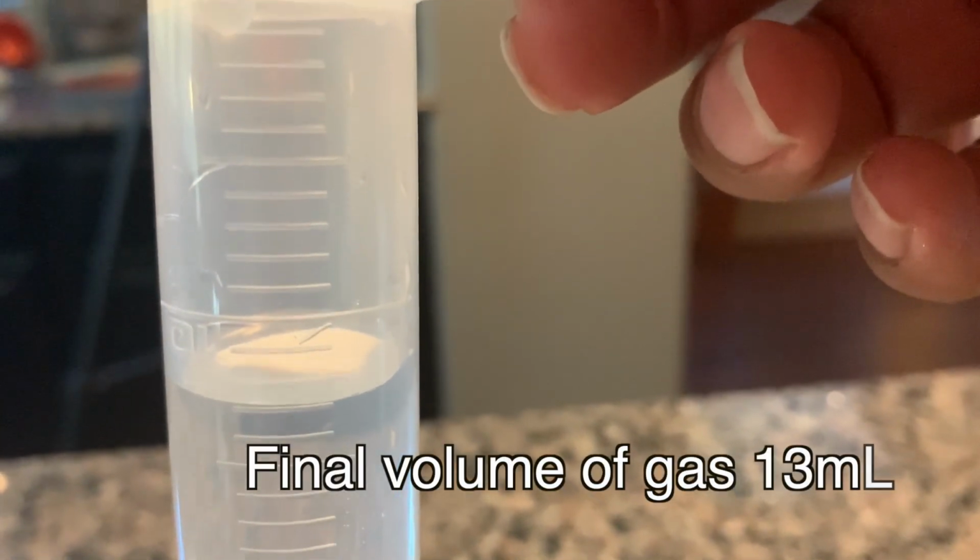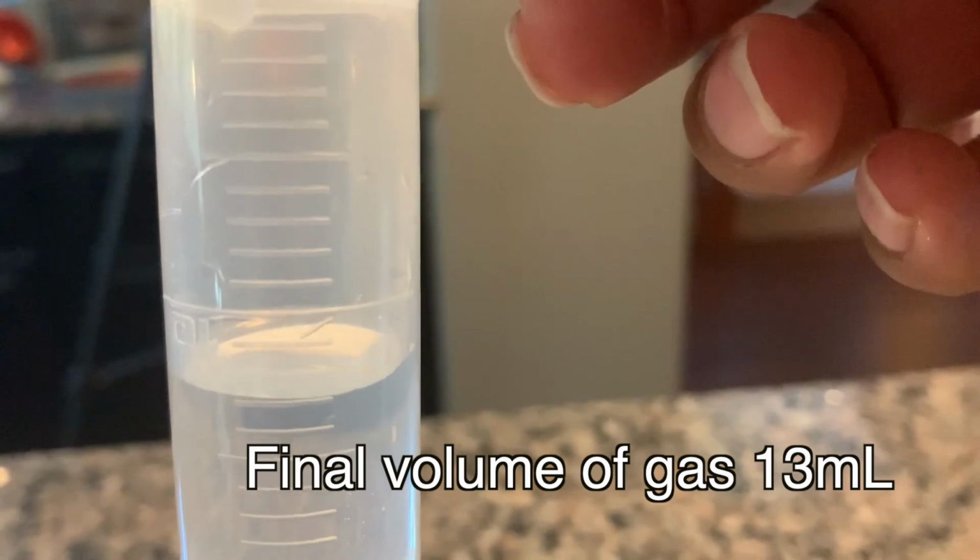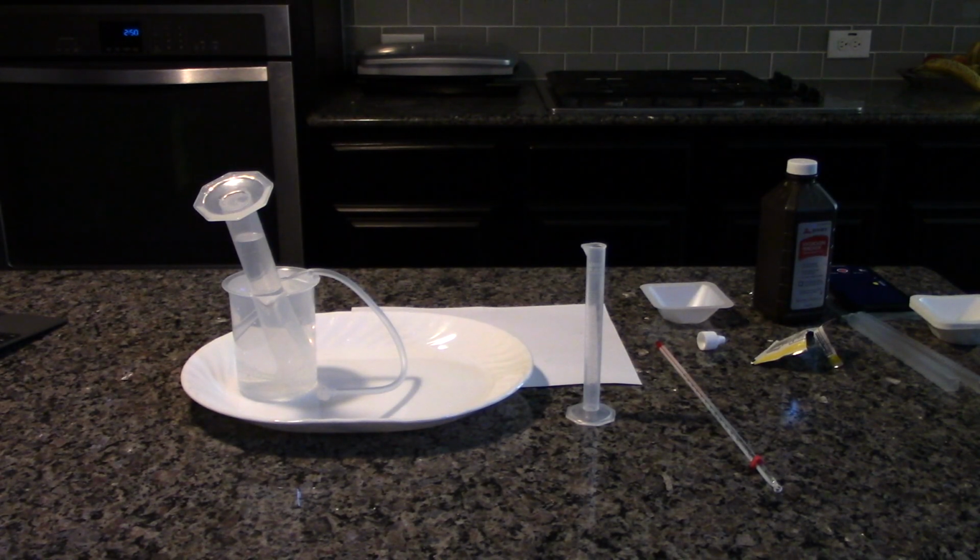Record the final volume of gas in data table 1. Calculate the change in volume in milliliters and record it in the data table. Remove the top from the bottle, pour the contents down the sink, and rinse the bottle 3 times with water. Repeat the activity using 1 milliliter of hydrogen peroxide.